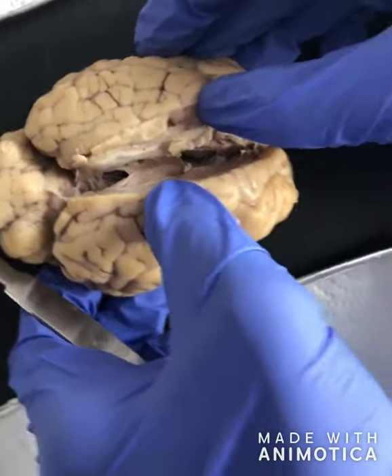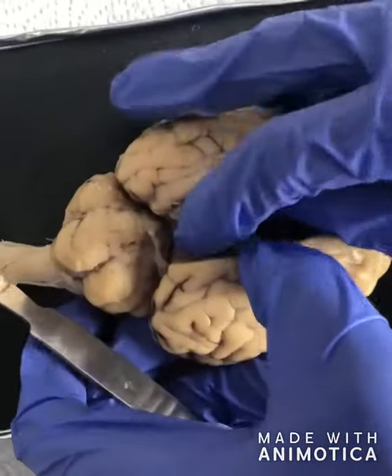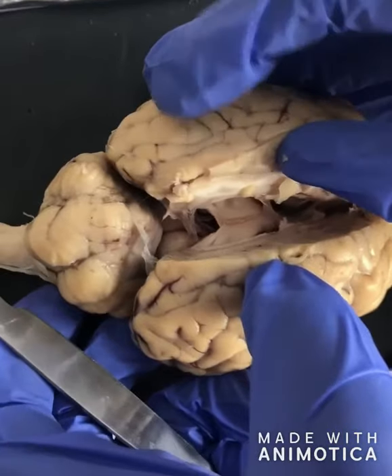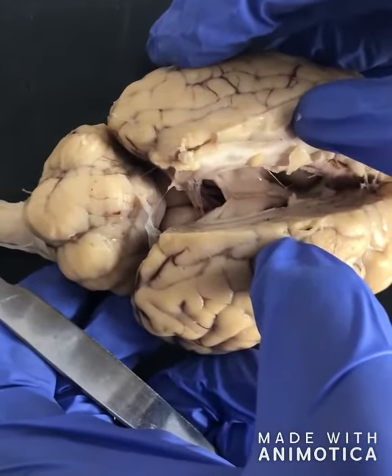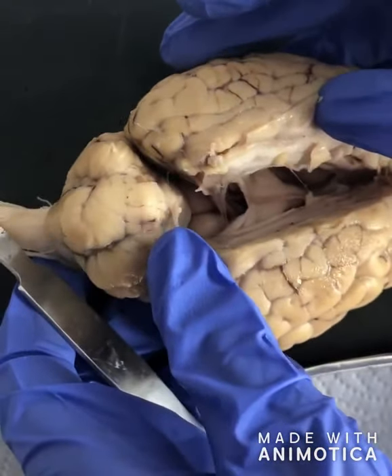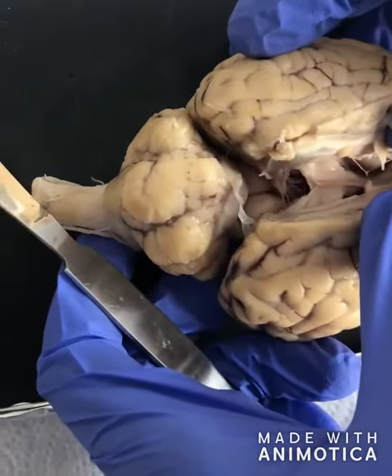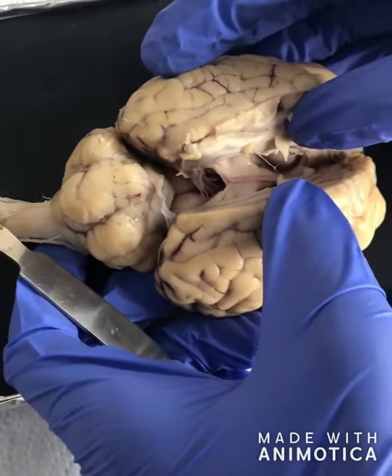Next, we'll be looking at the pineal gland. It's small and pea-shaped, and its function isn't fully known, but it does produce and regulate melatonin, which helps regulate sleep, and some hormones. The tectum is in the midbrain, and it is responsible for auditory and visual reflexes. It's located in the dorsal part of the mesencephalon. The superior colliculi is a layered and multisensory structure. The upper layer receives visual signals from the retina of the eye, as the lower layers process multiple signals from various other parts of the brain.